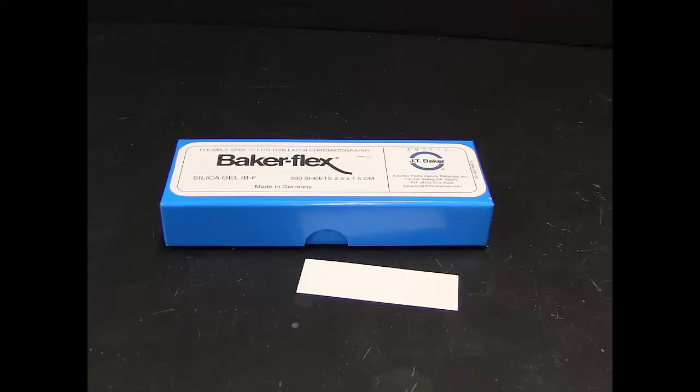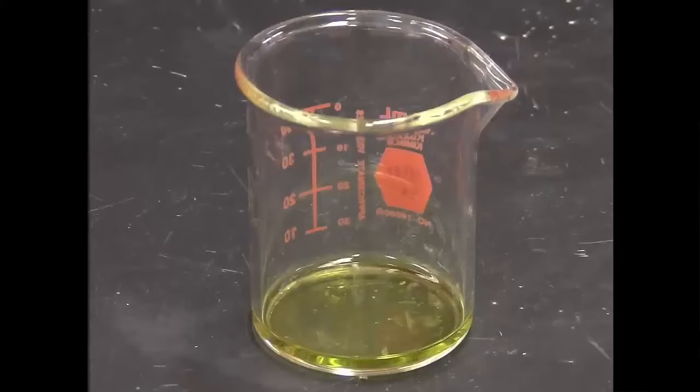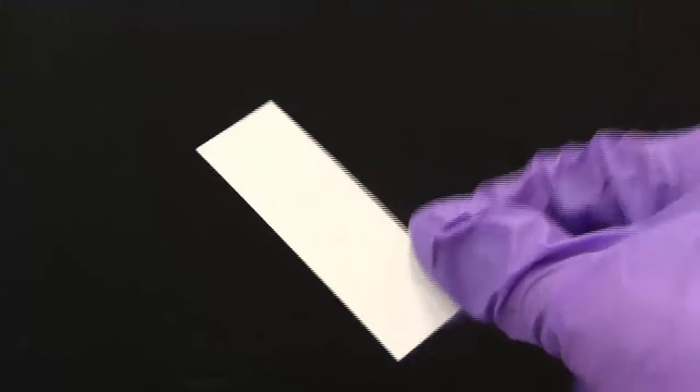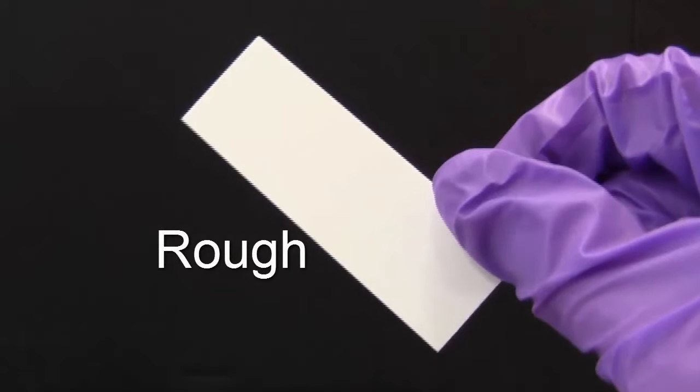For this experiment, we will use a TLC plate, a sample, and a solvent. The TLC plate has two sides. Be sure to use the rough side, which is coated in silica, for the experiment.